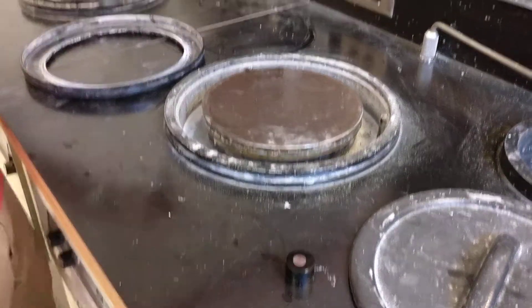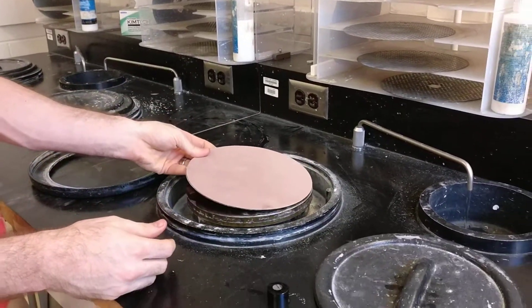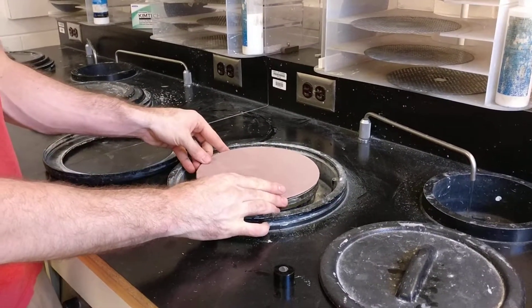The polishing disc has a big metal back so it's magnetic. We don't need any metal ring on the edge of this one.